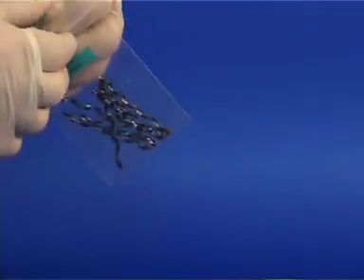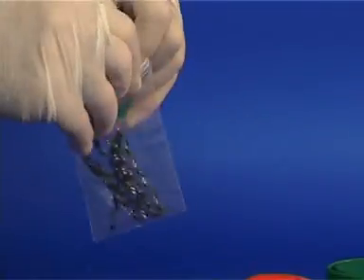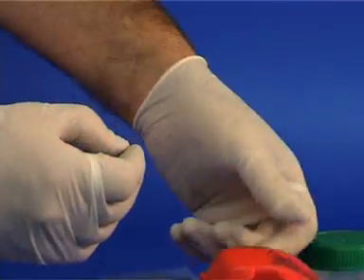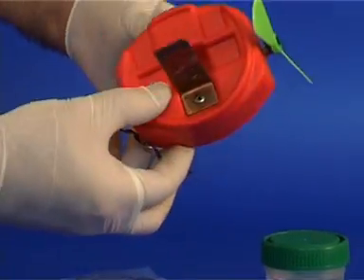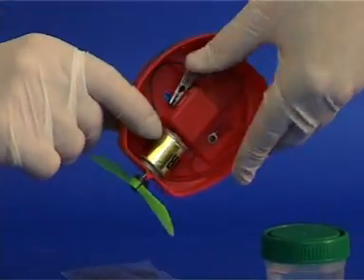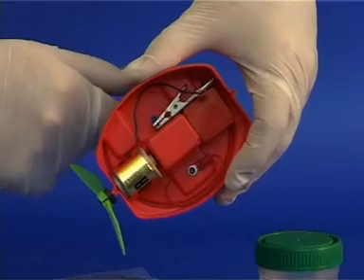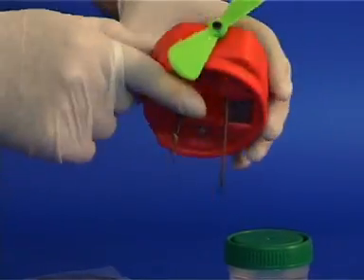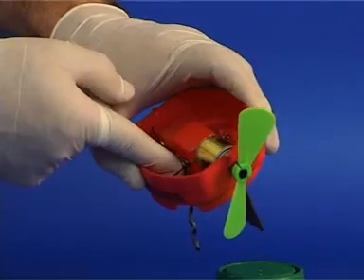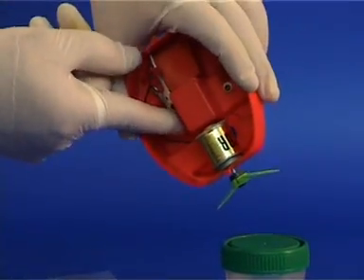There are several coiled magnesium strips in another bag. Take one. Put it through the round hole in the apparatus and secure it firmly with the alligator clip. It should be parallel to the copper electrode. Make sure the alligator clip is tightly fastened to the magnesium strip.